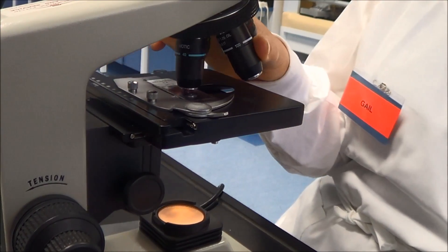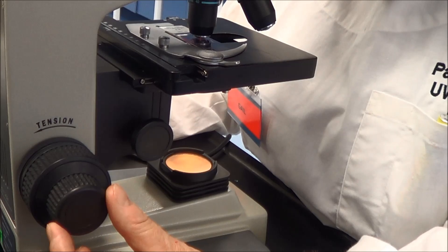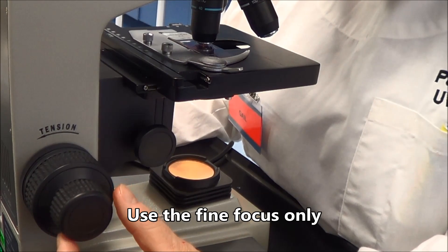Turn the nosepiece until the 40x objective is in place above the specimen. Refocus using the fine focus only.